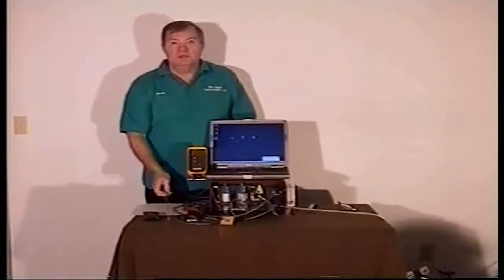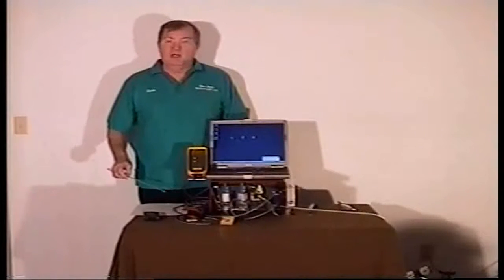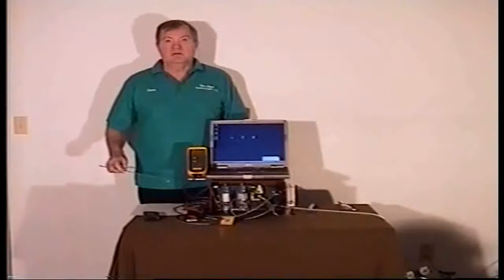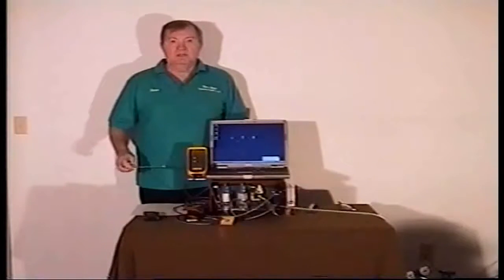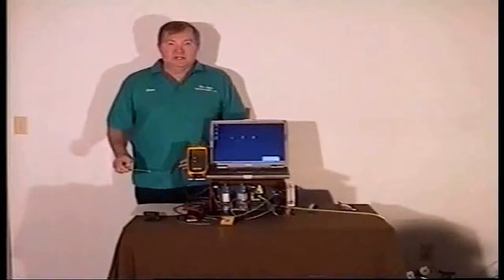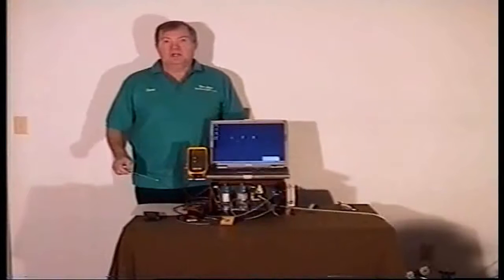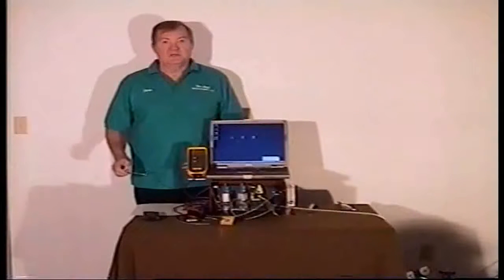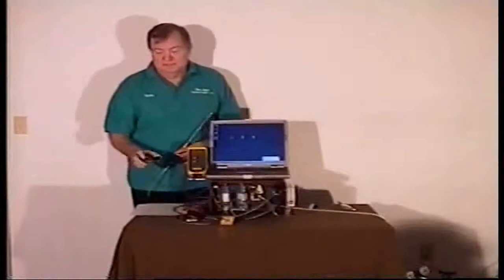This analyzer will continuously measure and record methane, carbon dioxide, carbon monoxide, oxygen, plus it has 6 additional inputs for sensors of your choice. This is a PC-based instrument. All the data is saved in an Excel format. This is ideal for digesters, fermenters, algae applications, and if you put a hydrogen sensor in there, it's ideal for syngas too. Let's come in for a closer look and put it through its paces.